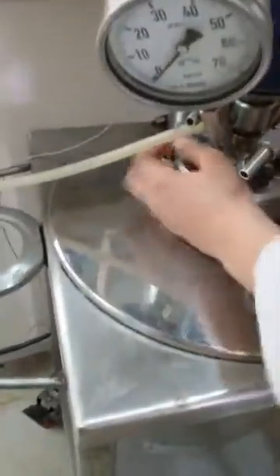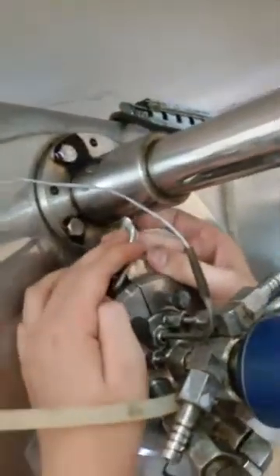I have these two clamps. Here, you put them like that and close them. You need to tighten them — be sure they are tight.